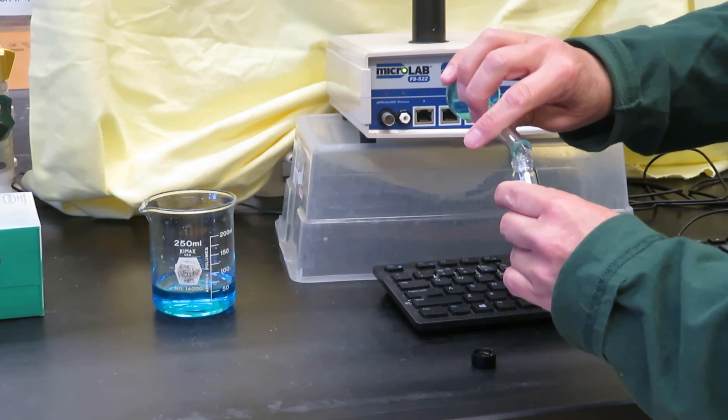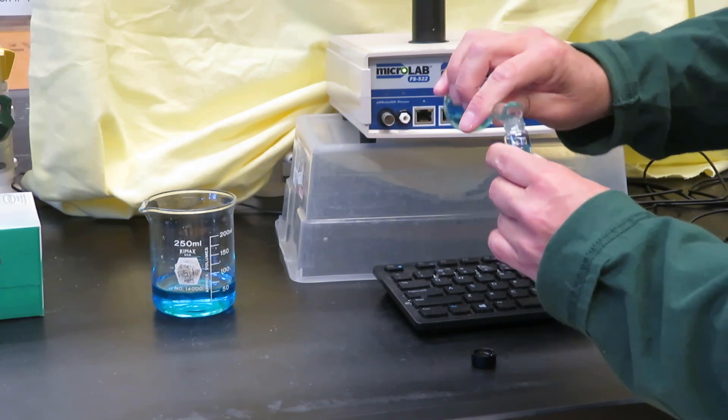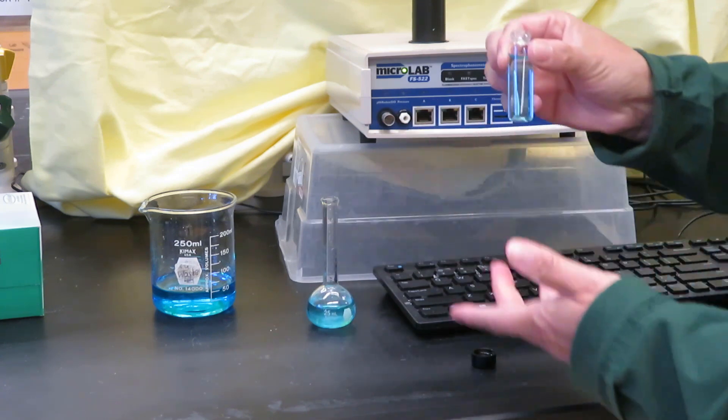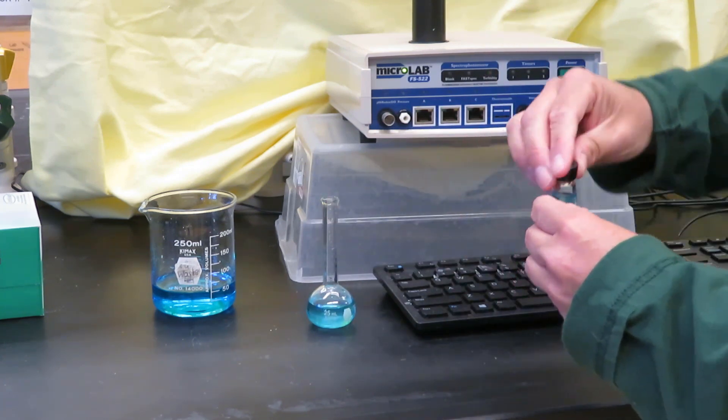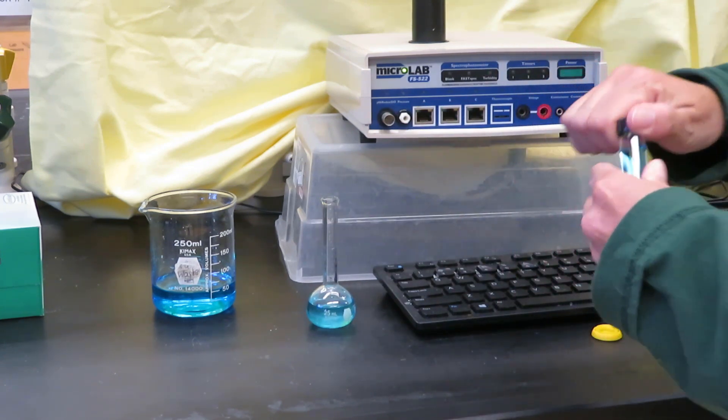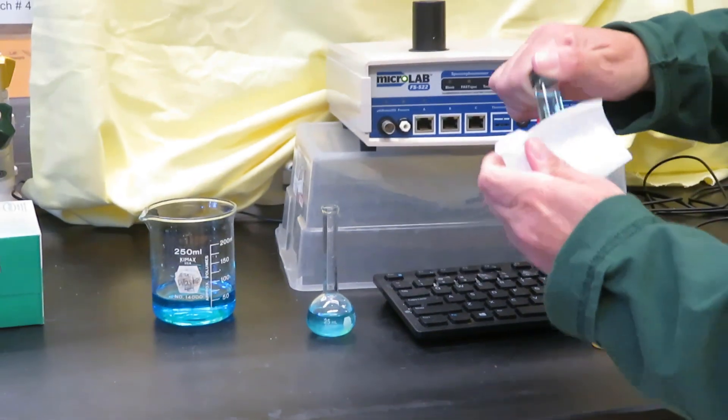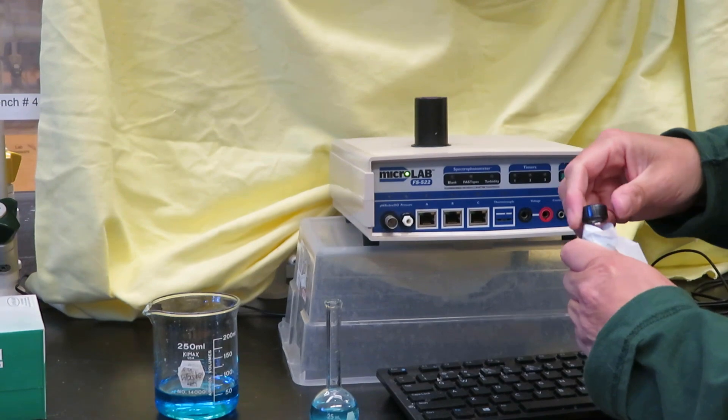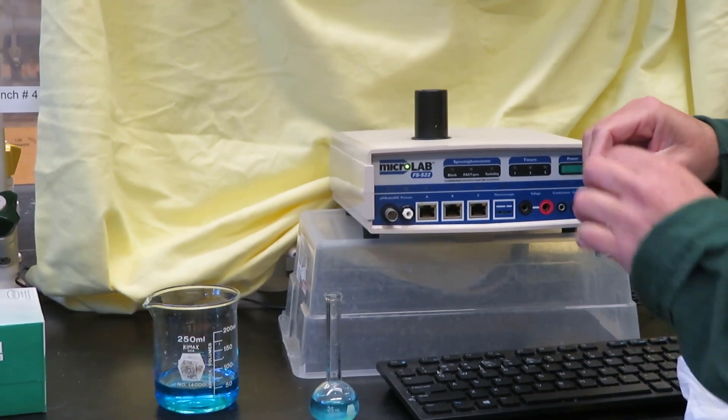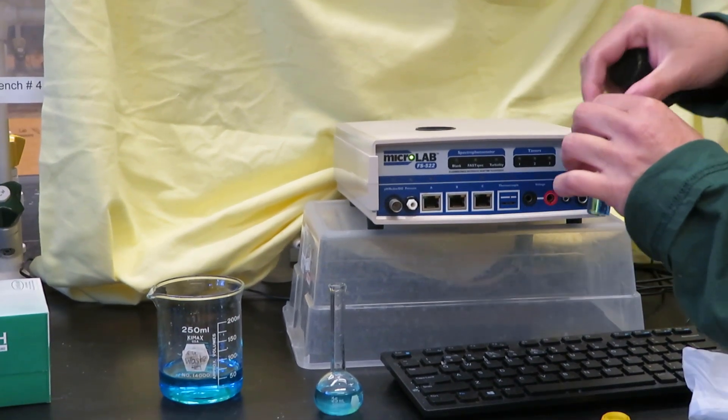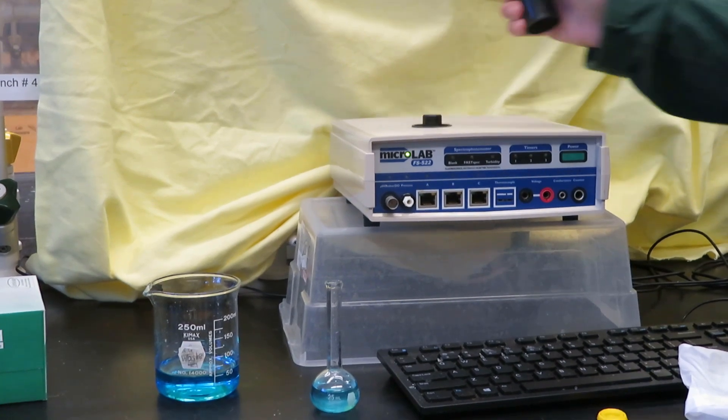Now fill the vial with the solution. Make sure that it's about three quarters or more full. Wipe any fingerprints off. And put our unknown in.